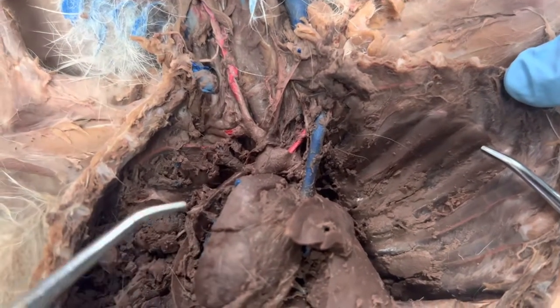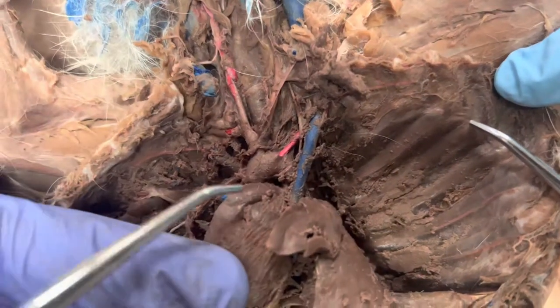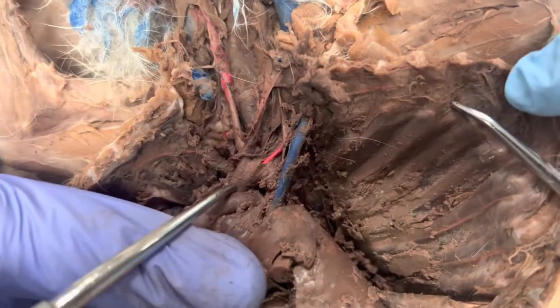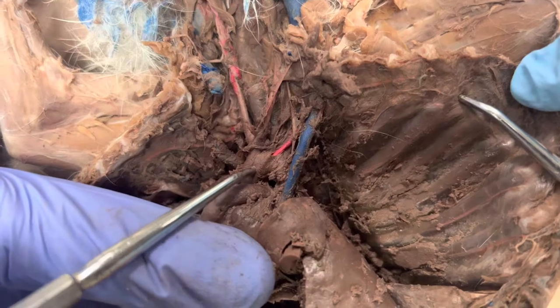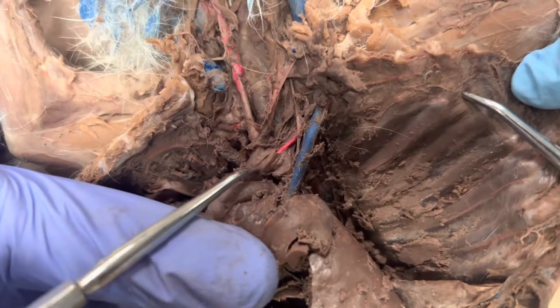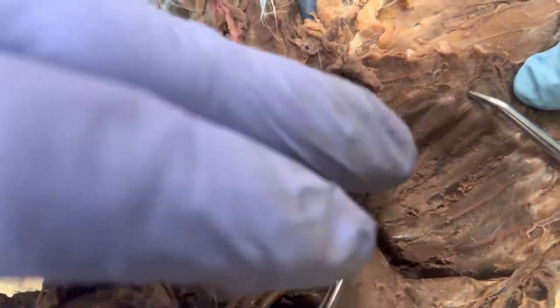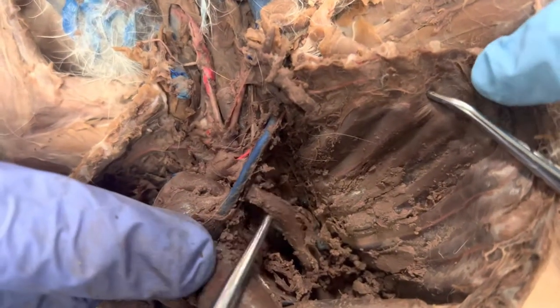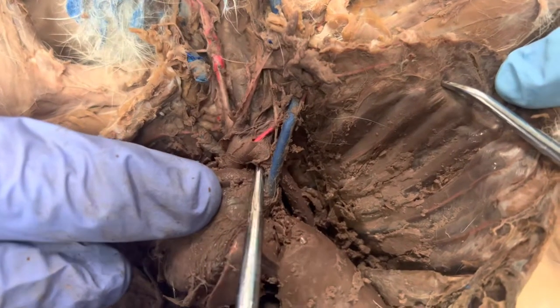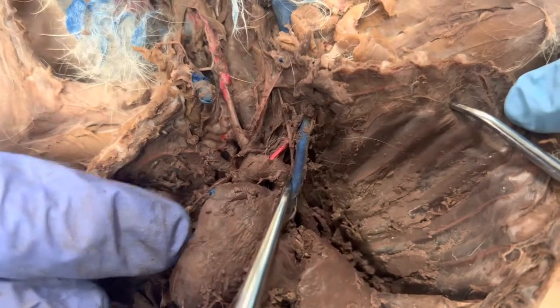This is looking at the arteries of the arch. This is my aortic arch right here — this part would be the ascending aorta, and then this is going to be the arch that goes right around like this, and then it comes over on the side, and this is going to be my descending aorta.